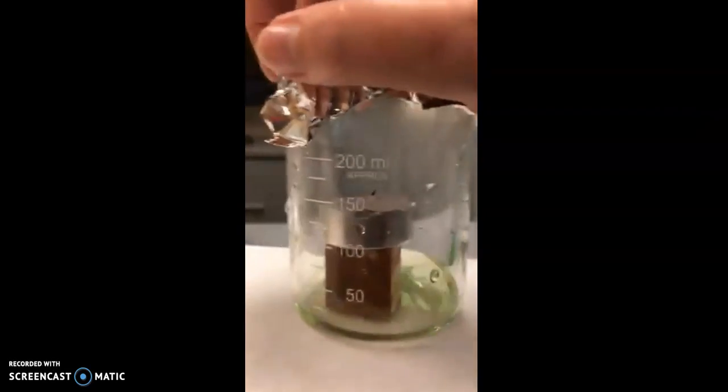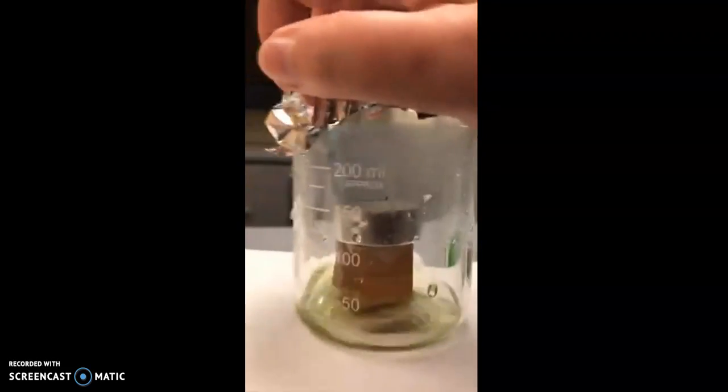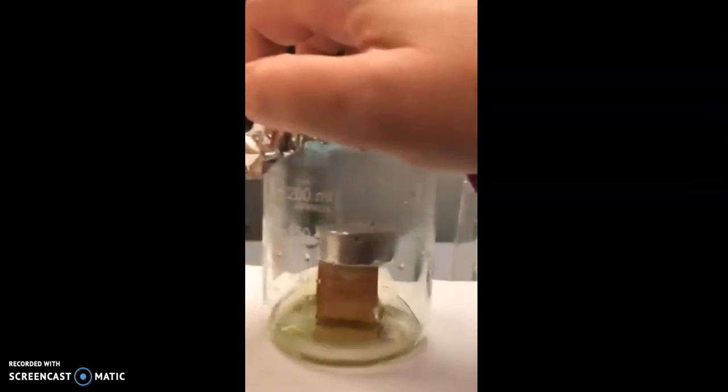And bromthymol blue is an indicator solution. In this case, it's indicating the presence of carbon dioxide. It turns yellow in the presence of carbon dioxide. So the candle was putting off carbon dioxide. It was burning oxygen, putting off carbon dioxide. And when we put the lid over the beaker, it trapped the carbon dioxide inside. It did not allow any more oxygen in. And as you can see, the bromthymol blue is now turning a very yellow color because it's absorbing the carbon dioxide in the air of the beaker.